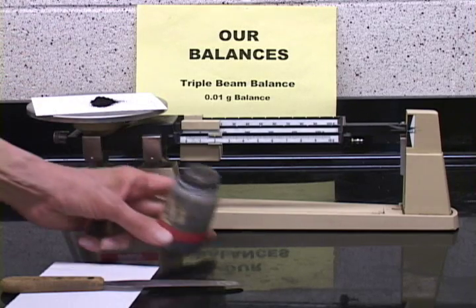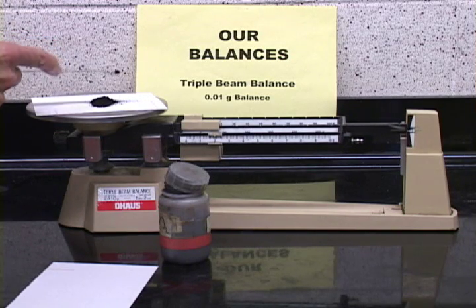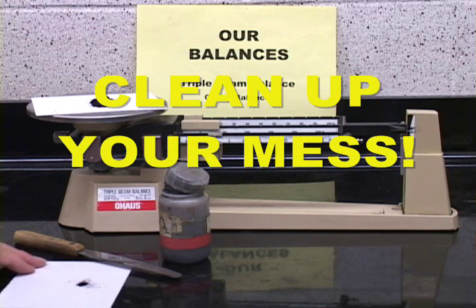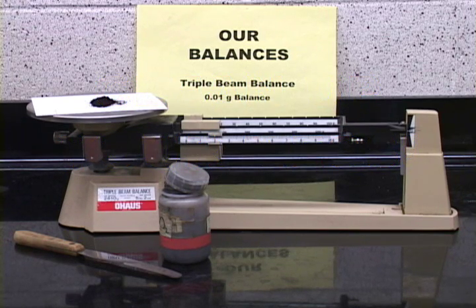And if you go slightly over, what you can do is take a little bit off and then throw the rest of this away. Remember, when you're through with the balance, get rid of and throw away all the waste material.